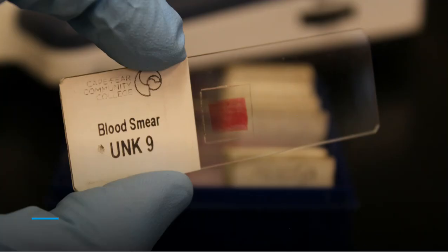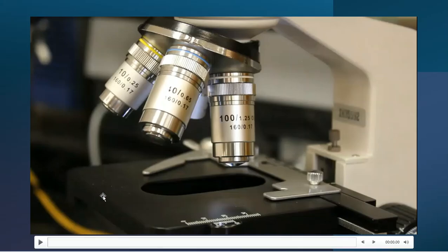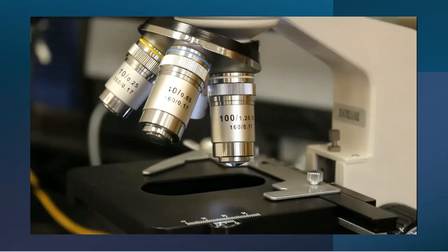All right. Okay, so let's kind of turn back to a couple more videos. Here's another one that's going to give you a little more close-up of the turrets.